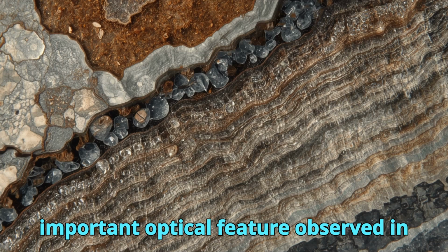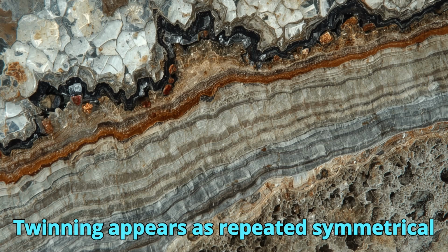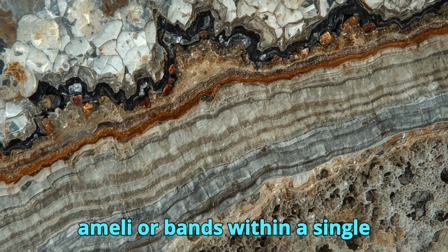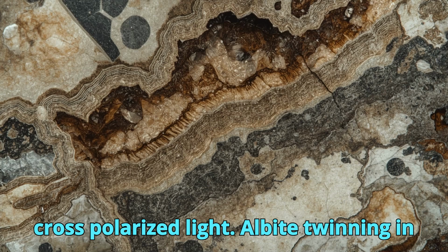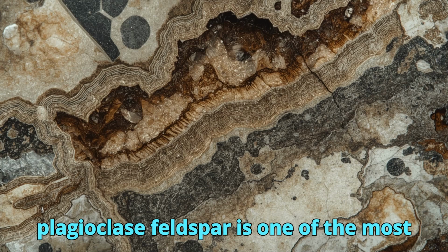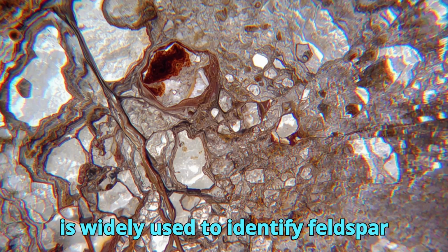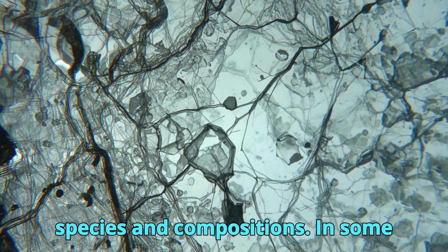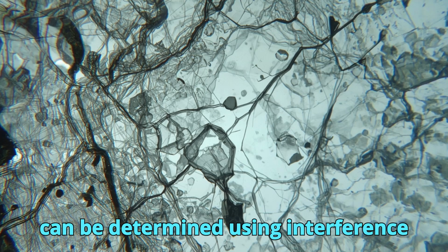Twinning is another important optical feature observed in many minerals, particularly feldspars. Twinning appears as repeated, symmetrical lamellae or bands within a single crystal and is best seen under cross-polarized light. Albite twinning in plagioclase feldspar is one of the most recognizable patterns in petrography and is widely used to identify feldspar species and compositions. In some minerals, optical sign and optic angle can be determined using interference figures, which are observed under high magnification with convergent light.